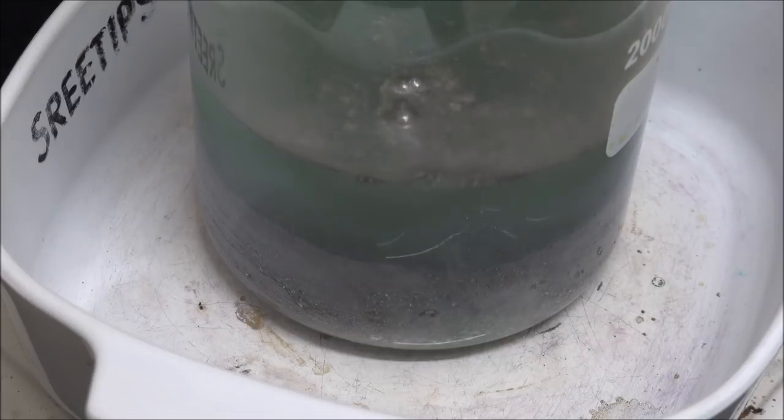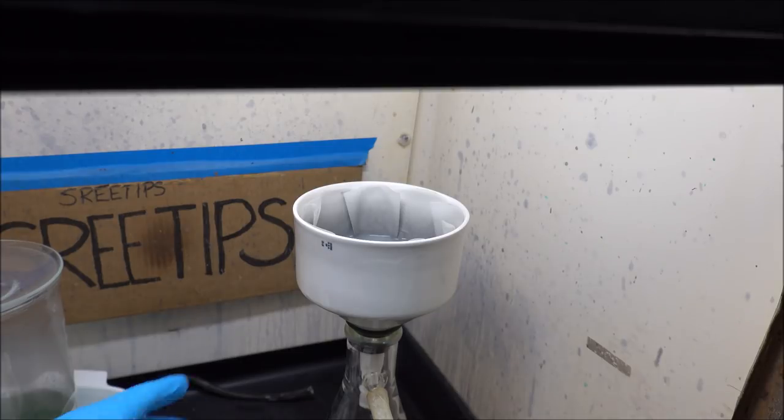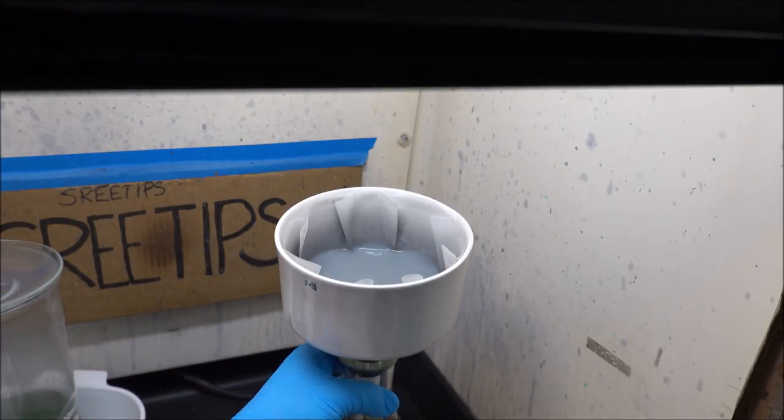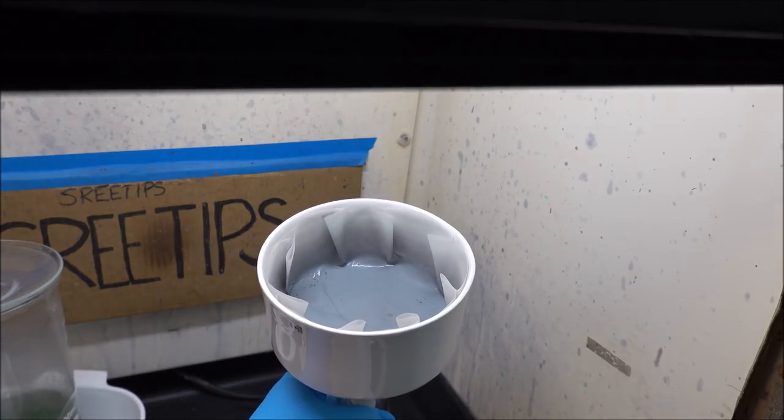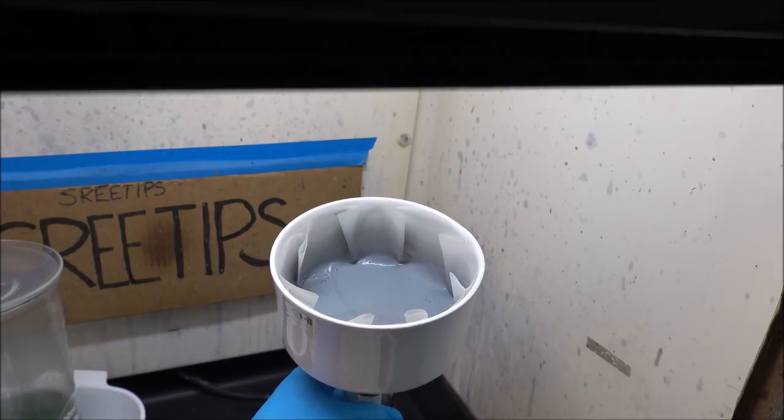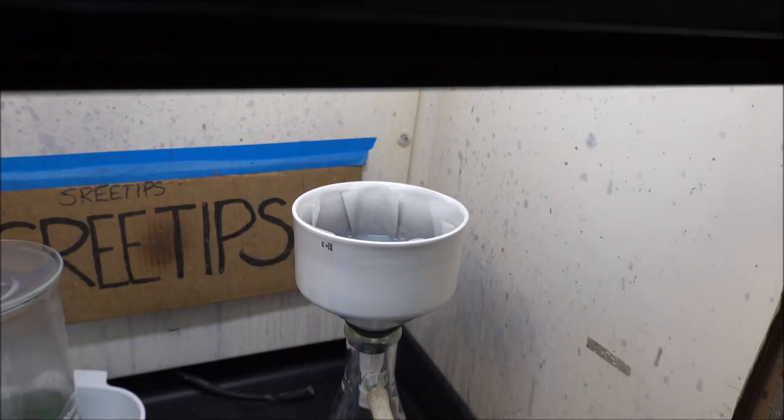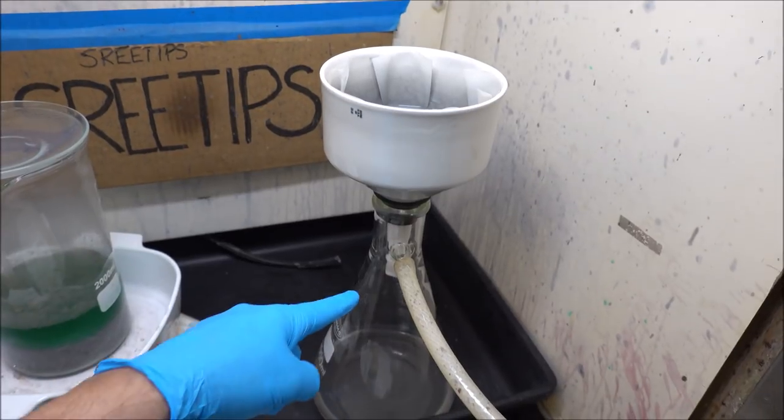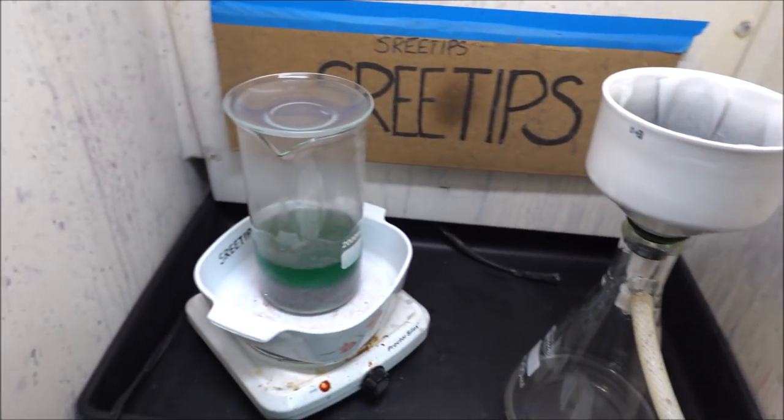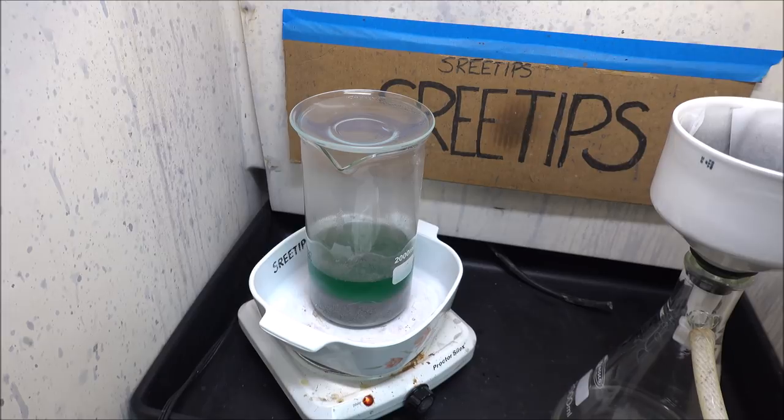I'm starting to get a little bit of reaction. The solution is turning green, gray color. I've had this on filtering now for about an hour and a half. Exactly what I thought would have happened - those finely ground up pieces of material have clogged that filter. It's filtering out, but it's coming out drops at a time.